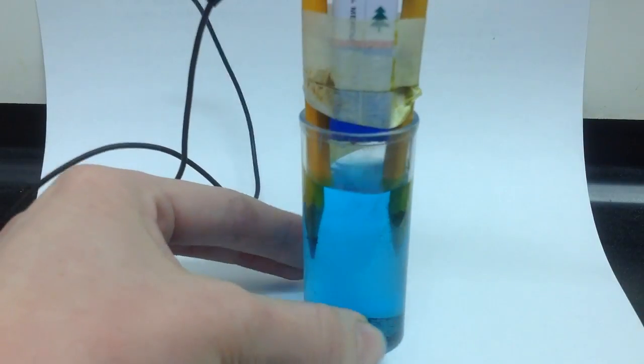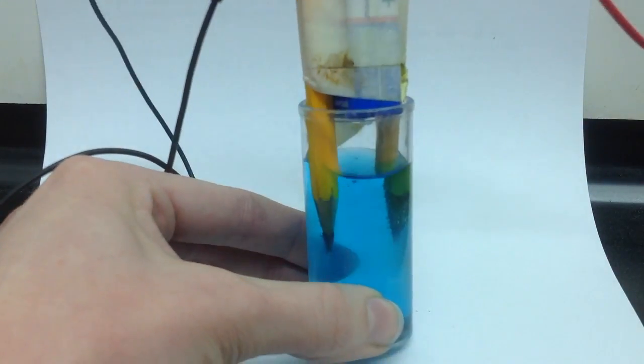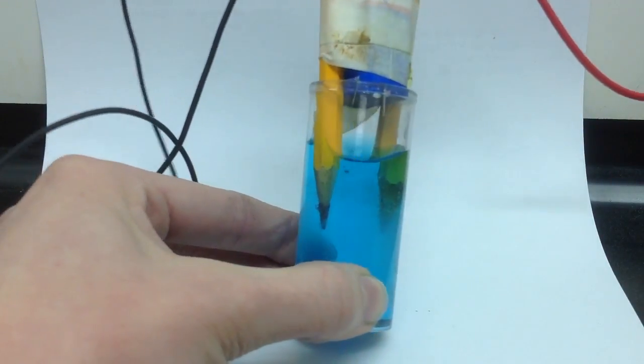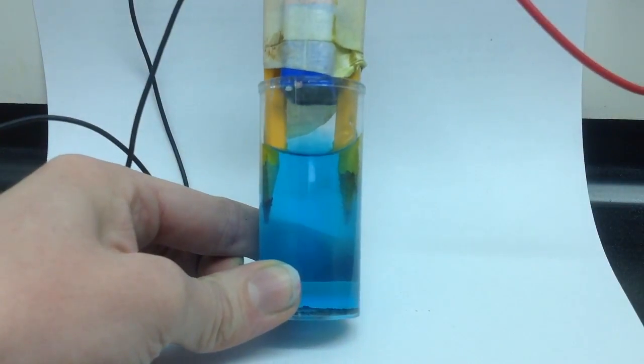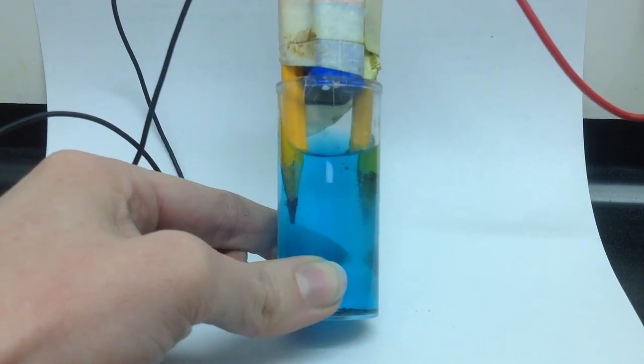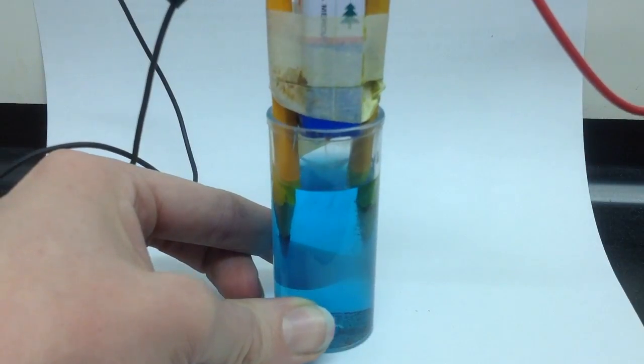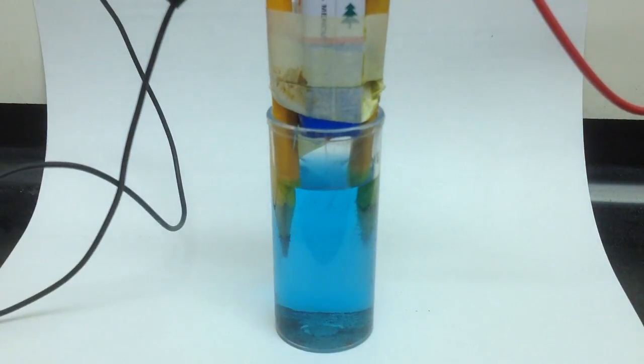On this side, it takes a little bit longer to see what's happening. So, you might have to wait a little bit. But, eventually, we'll start seeing some material that is accumulating on the tip of our other electrode.